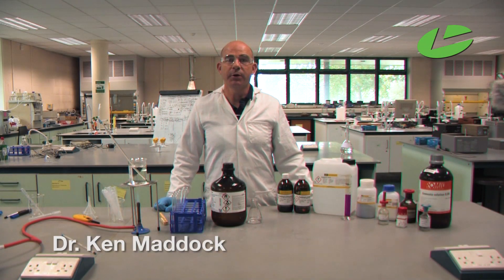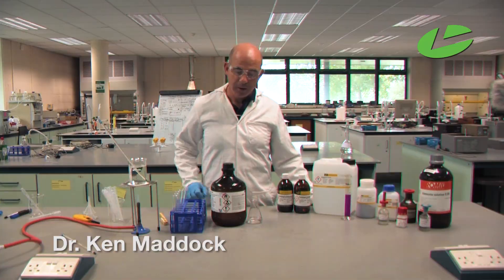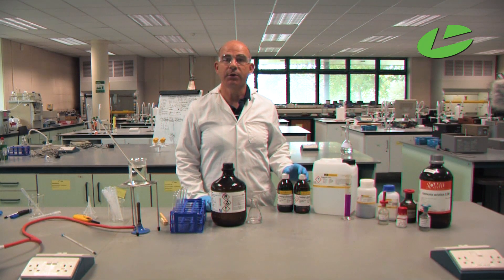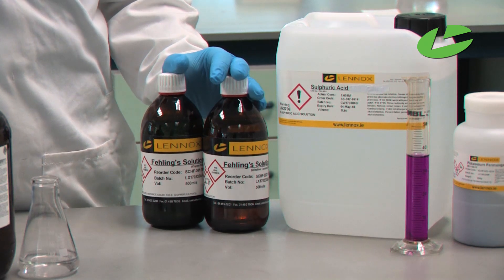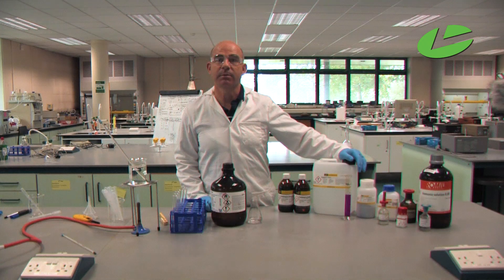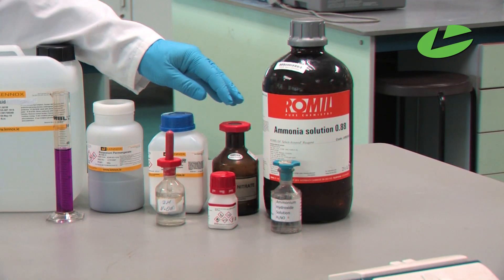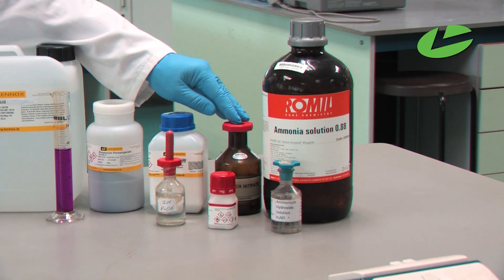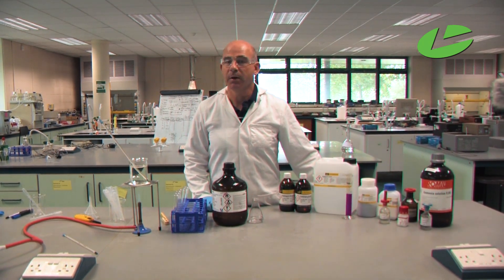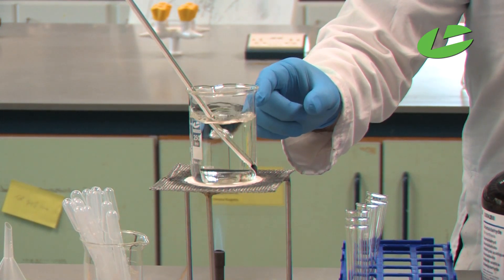In this experiment I'm going to be doing the three tests for determination for the presence of an aldehyde. I have my aldehyde here. I'm going to be creating Fehling's solutions by adding together Fehling's one and two. I have a solution of acidified potassium permanganate, and here I have solutions of sodium hydroxide, silver nitrate and ammonia which when added together will make Tollens' reagent. I'll be using a water bath to ensure the reactions go to completion.